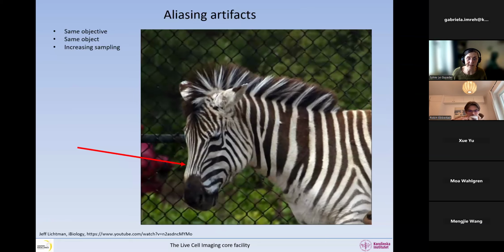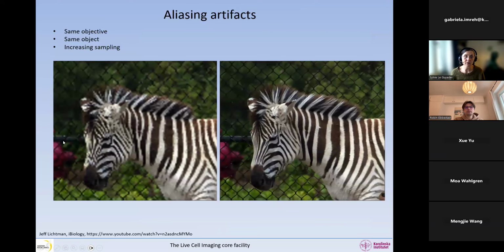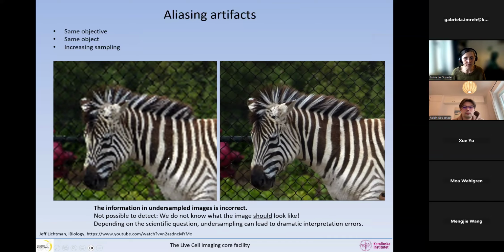Okay, so we keep on going and now we are resolving even the fine lines on the nose of the zebra. So we compare an image that is undersampled with an image that is sampled. You can see that there are a lot of things in this image that are wrong, like seriously wrong. Okay. The problem is that we do not know what our samples should look like. So the information in the undersampled images is incorrect. It's not possible to detect because we do not know what to compare with. We don't know what the image should look like.